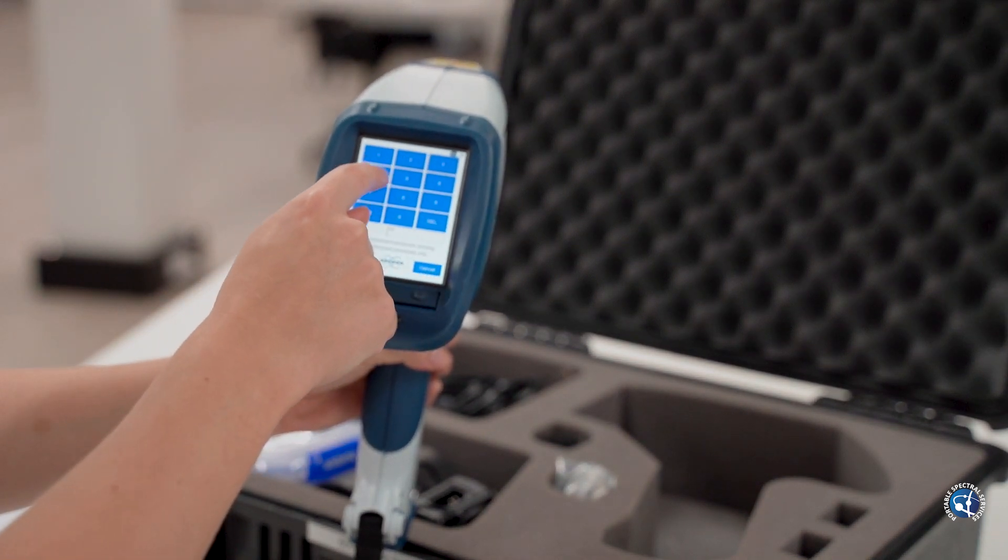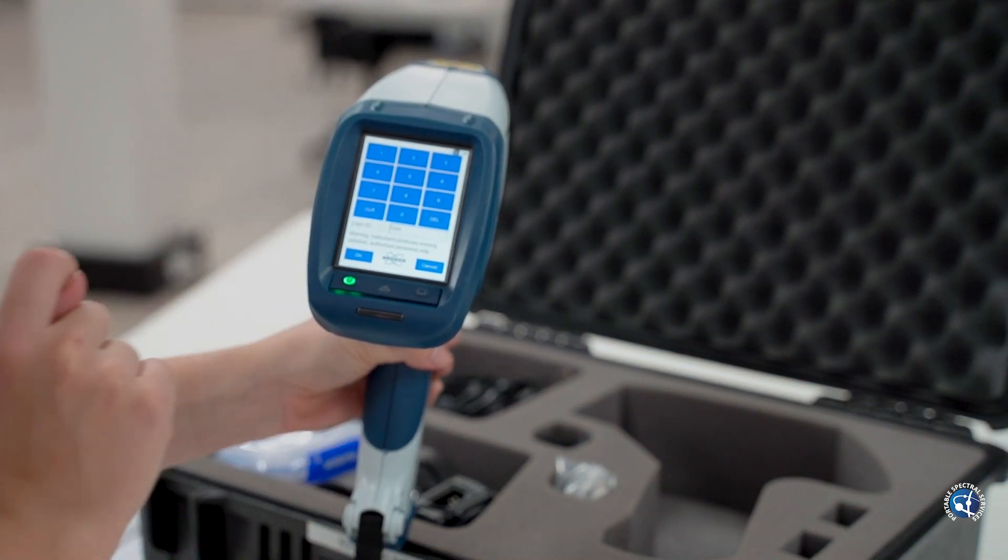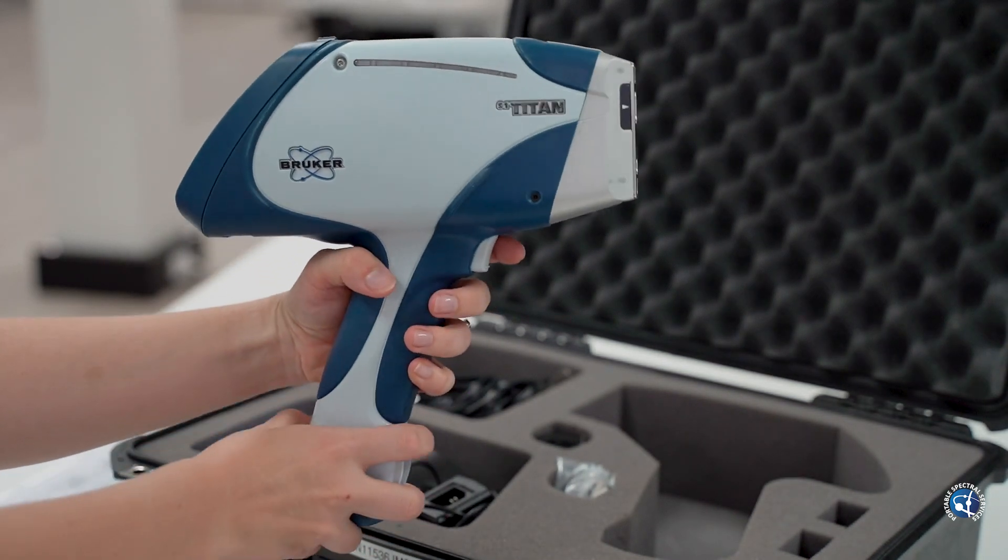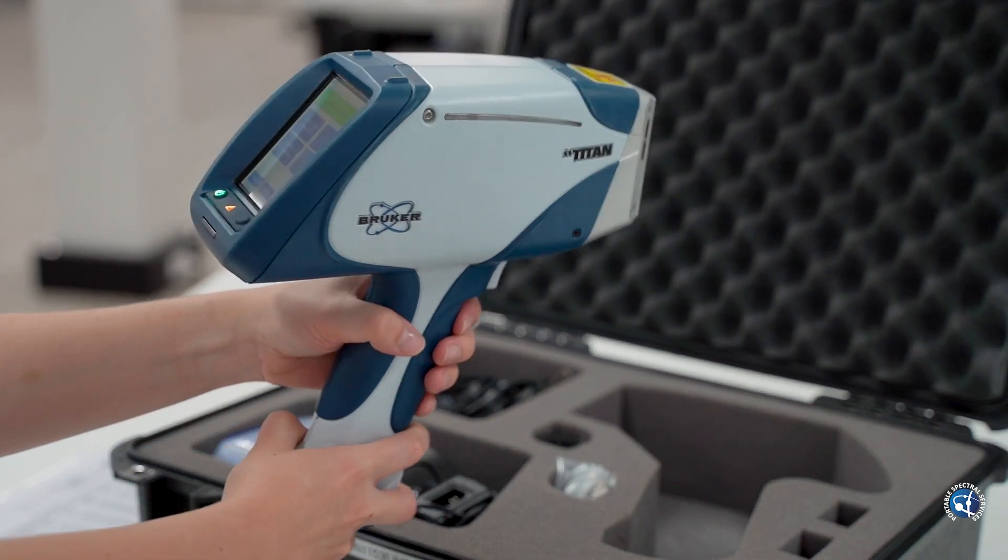Place in your credentials provided and a radiation warning will be displayed. Press the trigger and OK to the application settings. This will take you to the home screen.